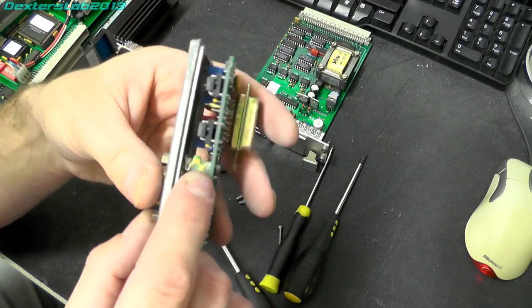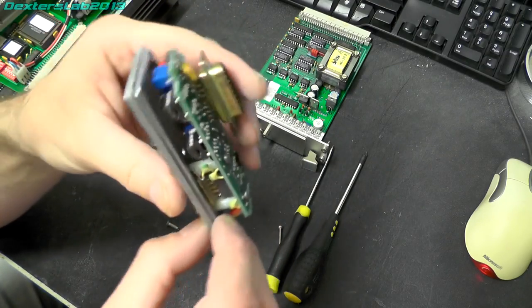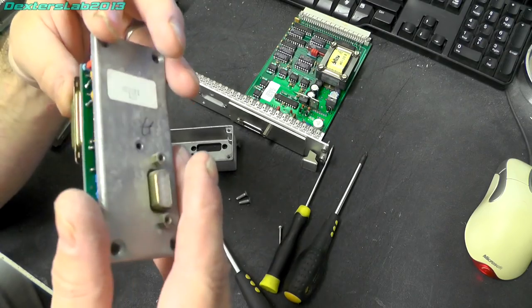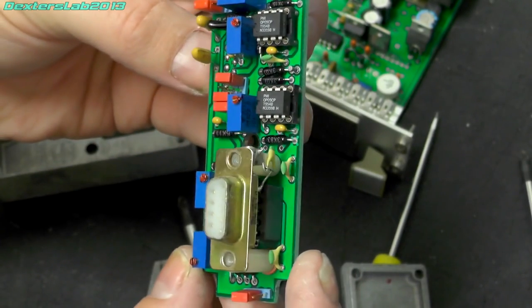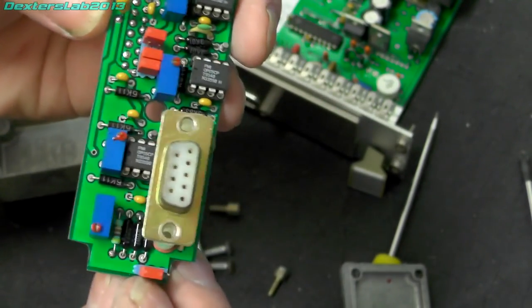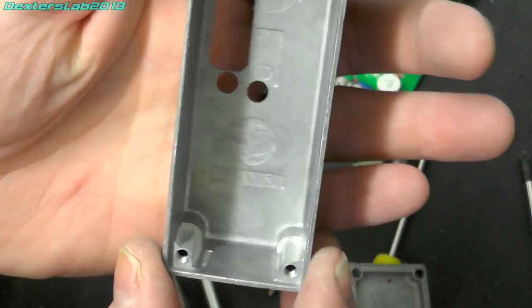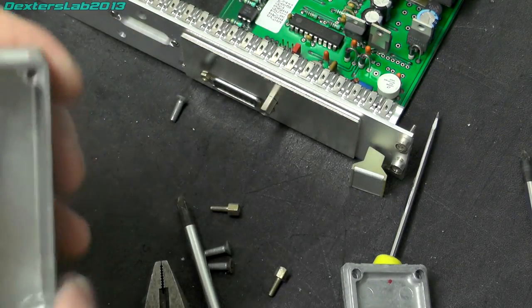I can't quite see, there's a couple of 8-pin devices on there. I can't quite see what they are. It could be op amps or something. A few other pots, trimmers, jumpers. Yeah, interesting. Okay. How does that come off? So yeah, it looks like we've just got some op amps. OP05. Yeah, those are going to be op amps, I'm sure of it. Interesting. Any ideas? Interesting, the boxes. Nice little Eddystone boxes, which is now Hammond, if I recall.